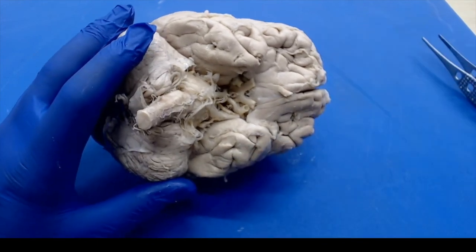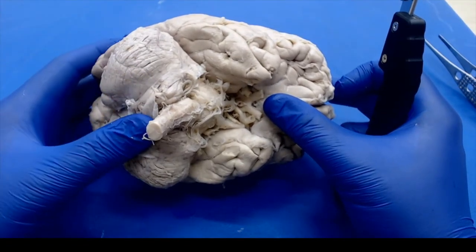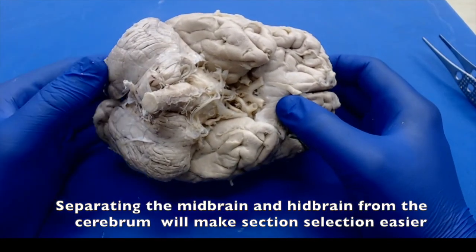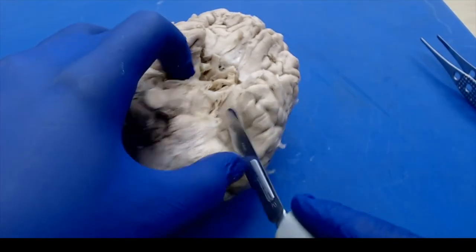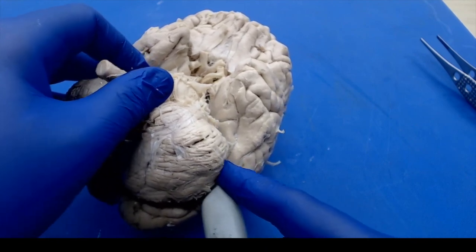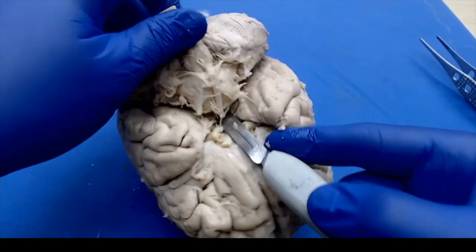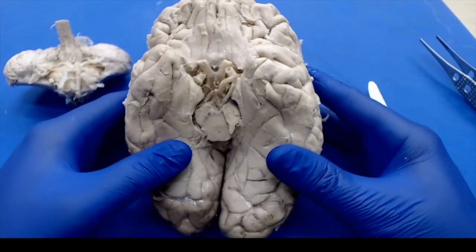And the first thing we're going to want to do, while you can cut everything as a whole brain cut, keeping the cerebellum and brainstem attached, I find it's often easier just to try to cut that away as best you can. And that way you'll be able to see your substantia nigra, which is an important section you want to take. Okay, so using just a regular scalpel, what I'm going to try to do is make a deep cut just above the midbrain and try to resect the midbrain from the cerebrum. Alright, there we go.